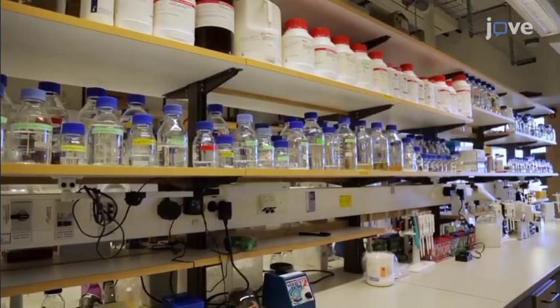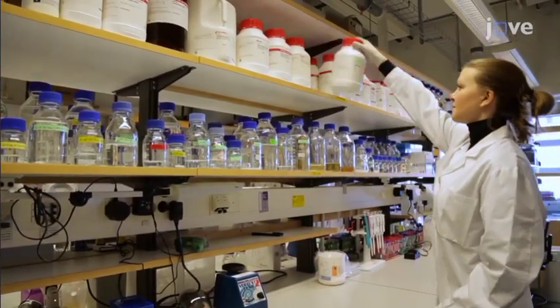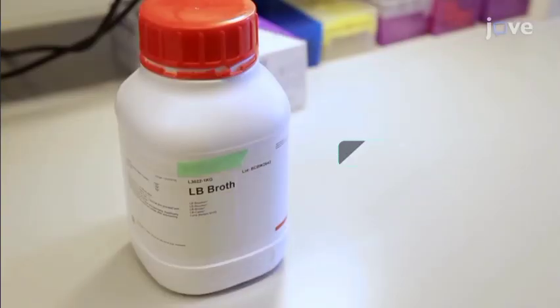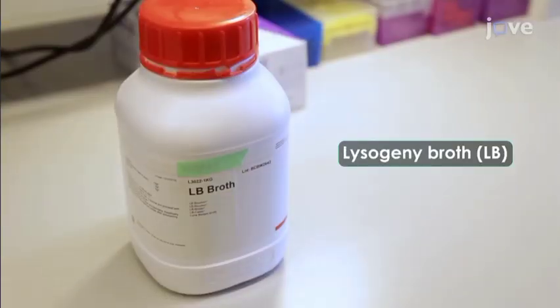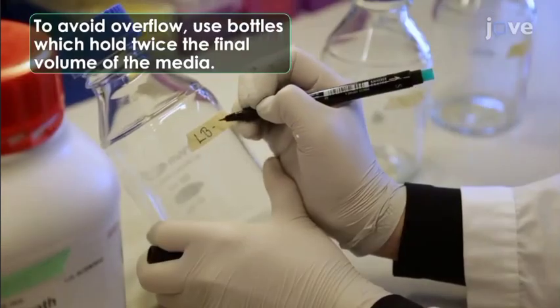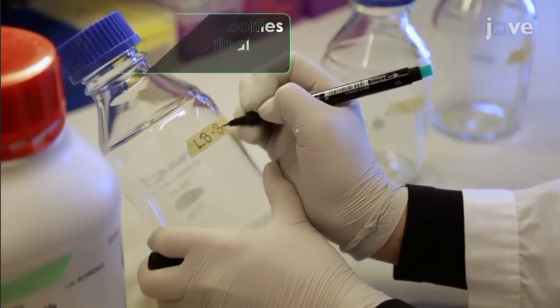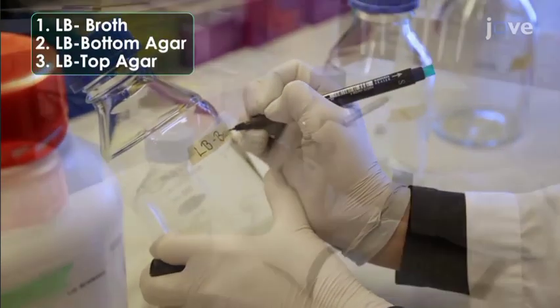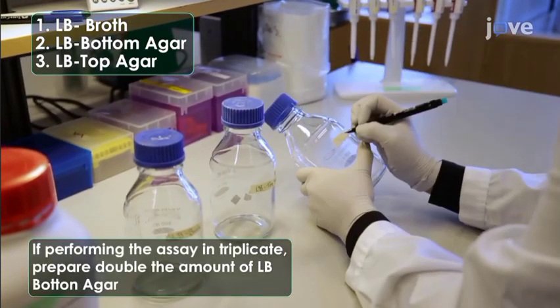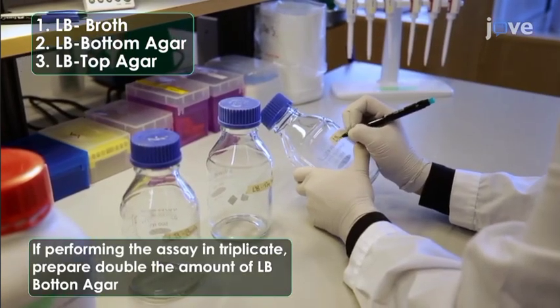First, identify a suitable medium for the culturing of the host bacterial cells and the bacteriophage. Here, lysogeny broth, or LB medium, was used to culture E. coli and the T7 phage. Next, take 3 clean glass bottles and label them with the media name, and then the first as LB broth, the second as LB bottom agar, and the third as LB top agar.